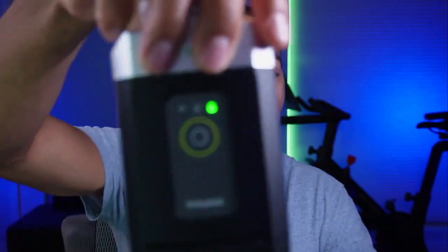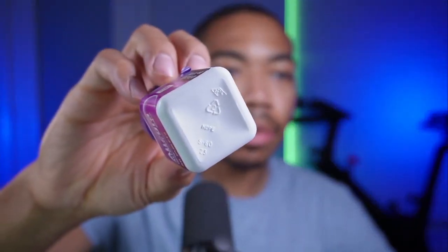So my wife is traveling, and I think this gives me the right time to do the beginning of my NIR in the home project. That is, I want to use a portable infrared spectrometer like this to analyze a bunch of chemicals in the home. And the benefit is when we look at these types of plastics, they oftentimes come with the label already. So I know that this is a plastic number 2. It is high density polyethylene. And many of these other containers are also labeled with the plastic type that was used to comprise and mold these products. And so that's what we're going to do.